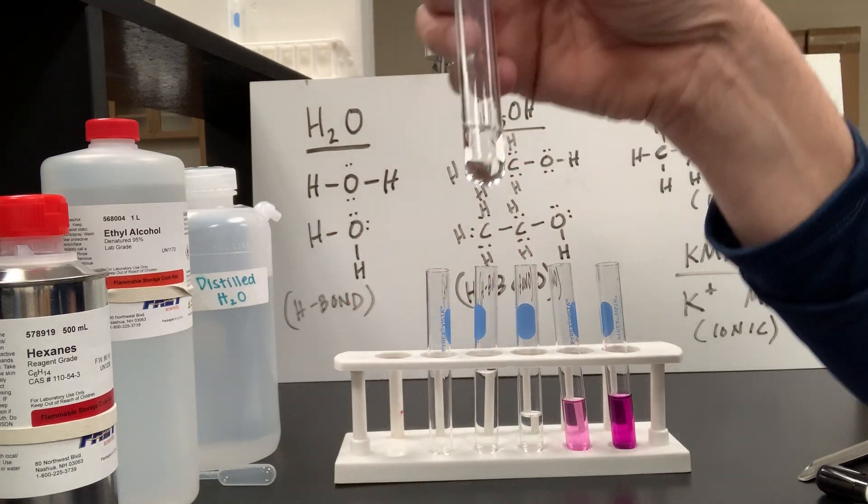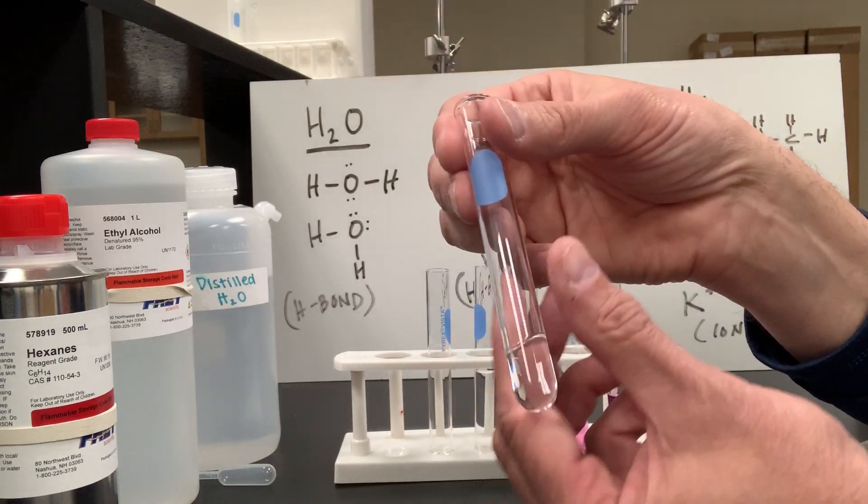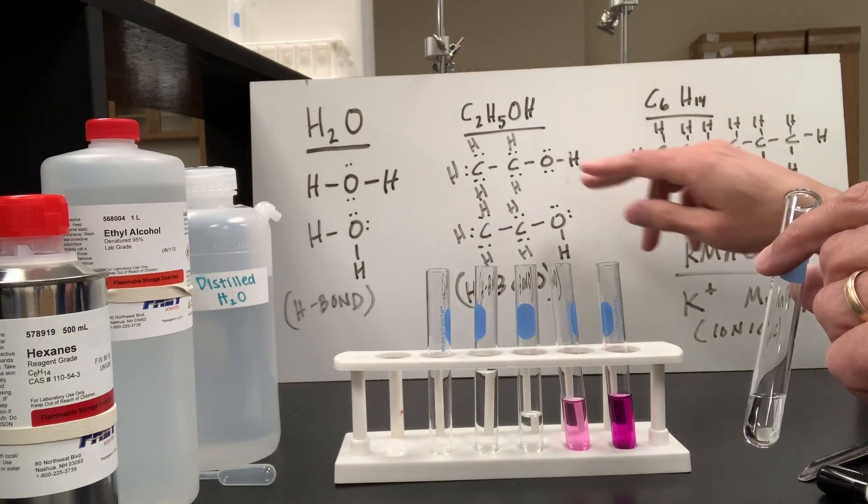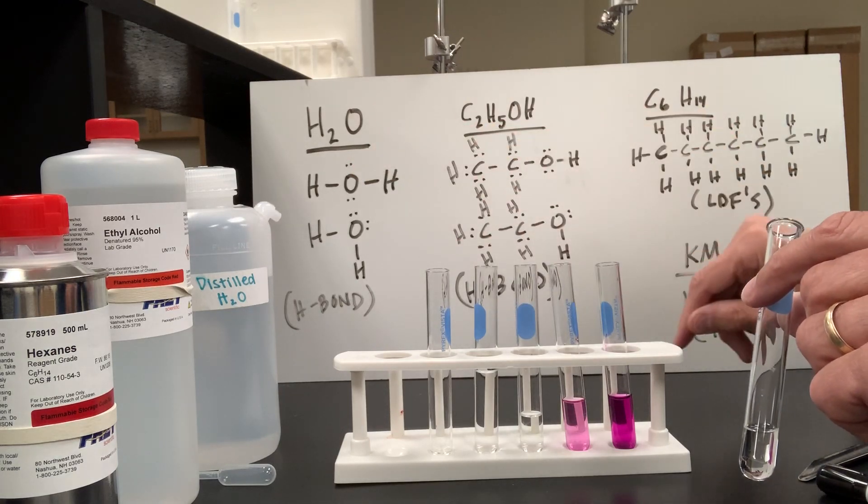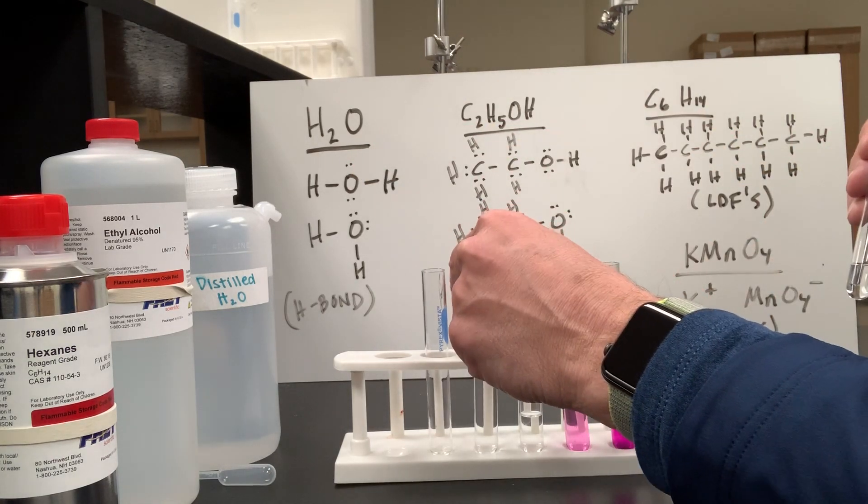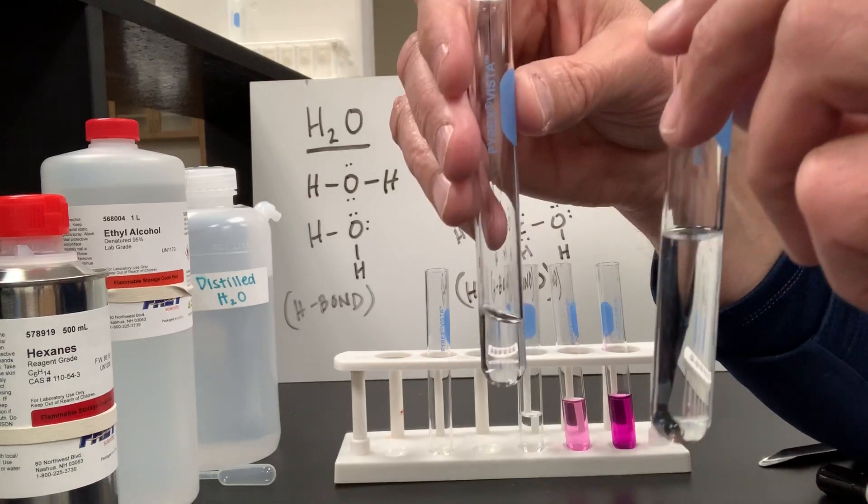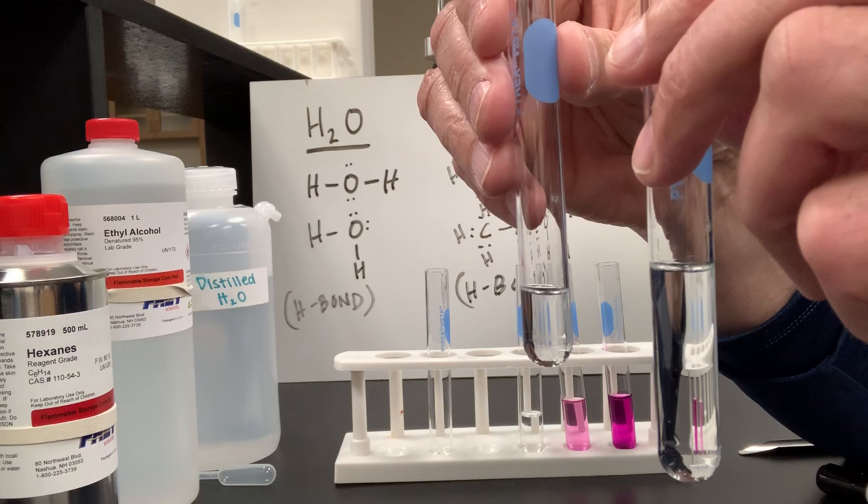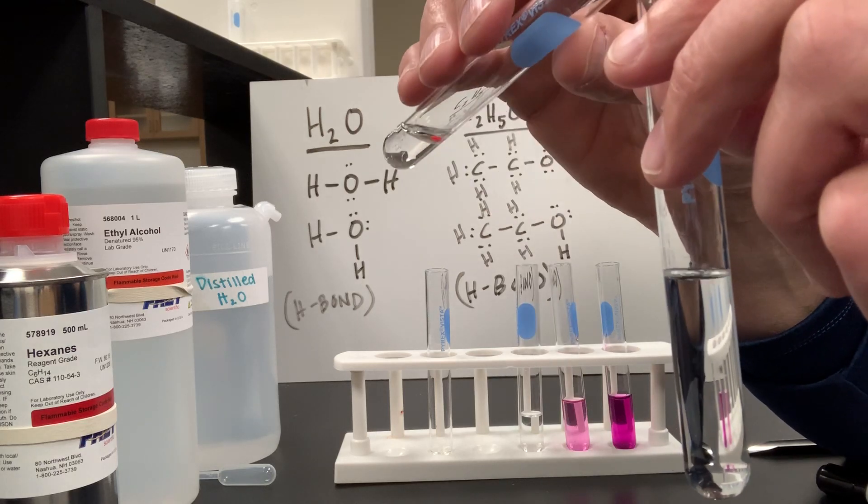Well, how about my hexane? My hexane, remember, has the intermolecular force of attraction of LDFs. Both water and ethanol have hydrogen bonding as their intermolecular force of attraction. They're not like each other at all. So what's going to happen when I pour the hexane into the water-ethanol mixture?